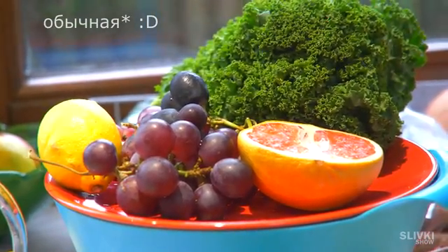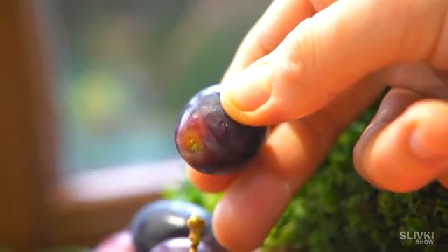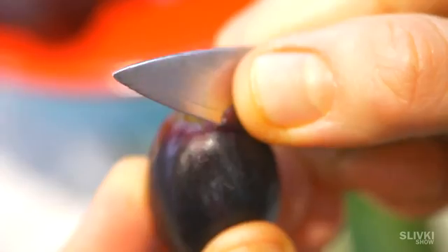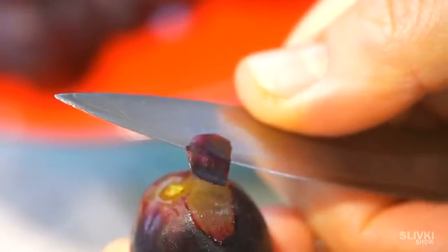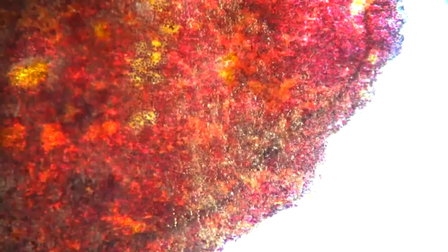Even such an ordinary thing as a dark grape can look very unusual under magnification. We are not looking at the pulp itself, but at a sample of the skin, which we carefully extract with a knife. At first, nothing special. But when we start to magnify more, we can see structures in the form of circles.